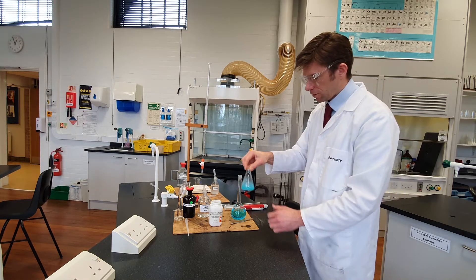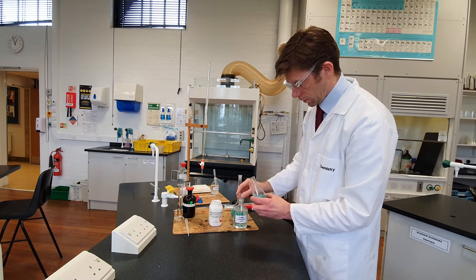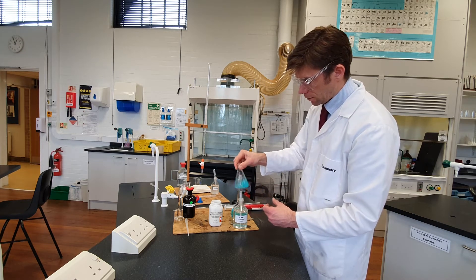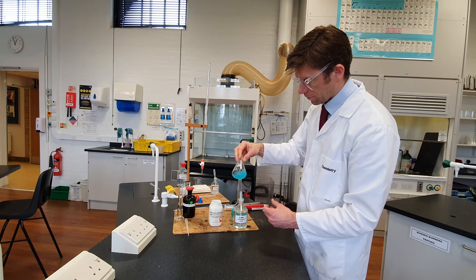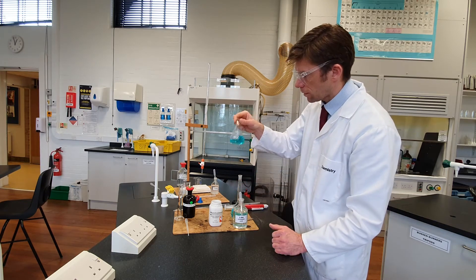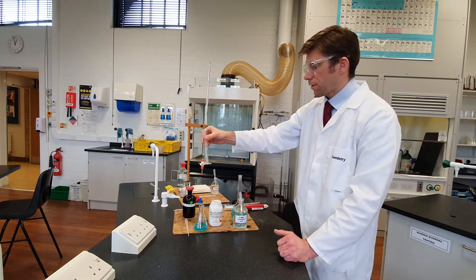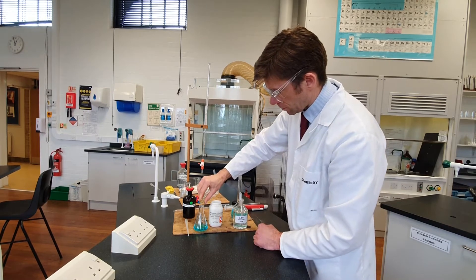Now we need to dissolve that precipitate by adding some ethanoic acid. Add the ethanoic acid carefully — we want that precipitate to just dissolve. Then the final thing to prepare is to add some potassium iodide solution. The potassium iodide solution is going to react with the copper ions.